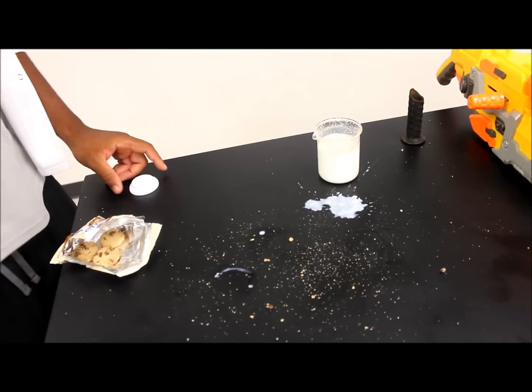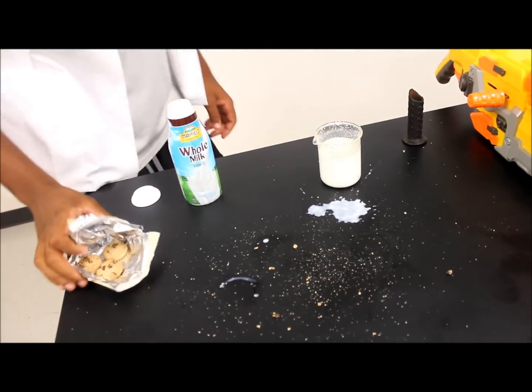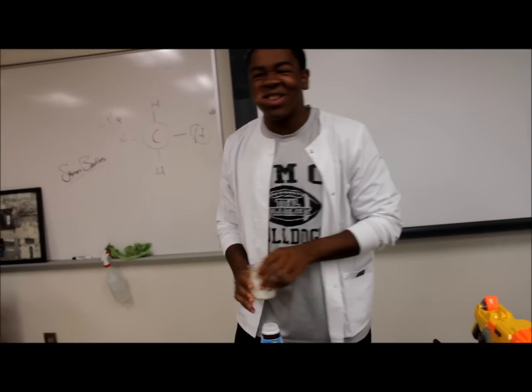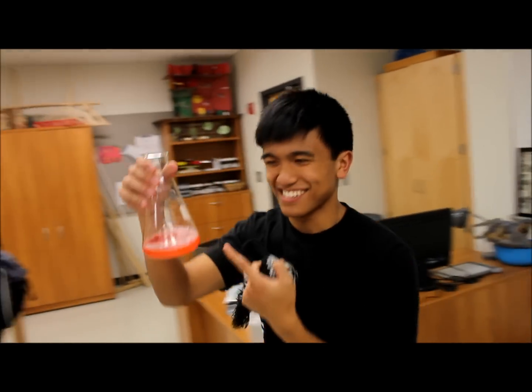This was Drastic's heterogeneous milk and cookies mixture. Dude, those are radioactive. I don't care. Cookies are cookies, man. I bought these in the canteen. Radioactive nothing. I didn't mean to do that. You'd be alright. Don't worry, Major Matt. At least I'm cleaning. This is just food coloring, okay? It's food coloring.